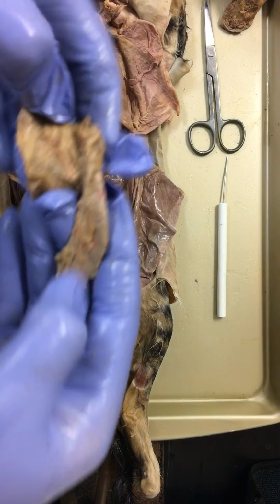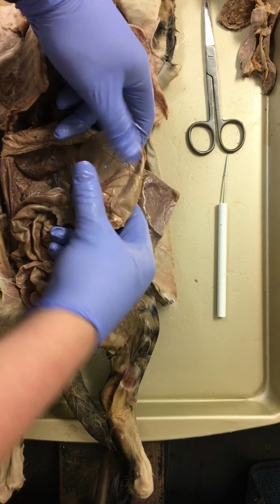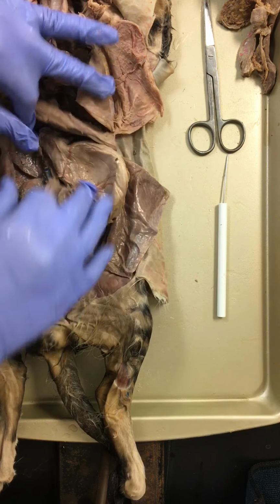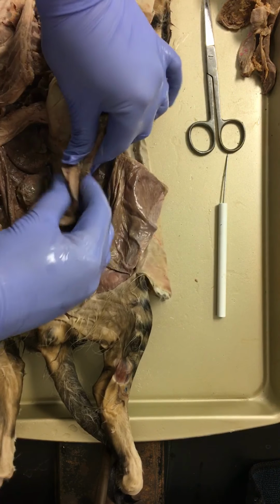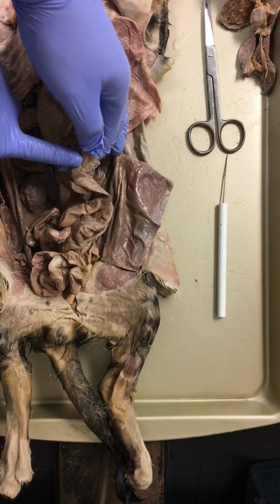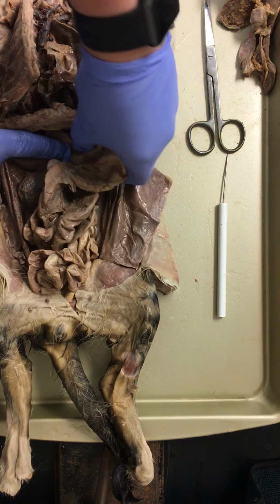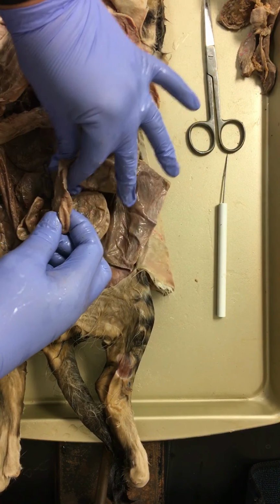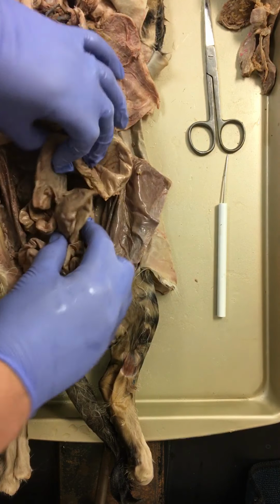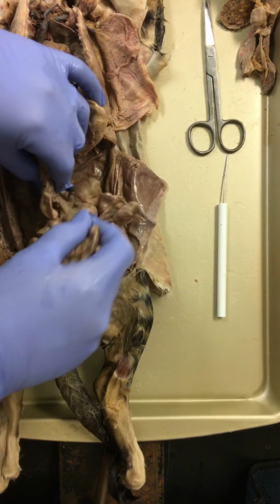We can see the pancreas on the back side of it over here. So we're going to leave that to the side. We have our stomach right here. Our stomach actually has some contents in it. You can see the diaphragm, how it's hooking to the esophagus, going to the small intestine right here. There is a sphincter muscle. This sphincter is like a little clasp that allows things to go into and out of. We have a sphincter on the top too. The stronger sphincter muscle on the inferior side than the superior side, and we go into the small intestines to see the duodenum first, or the first portion of this intestinal tract.